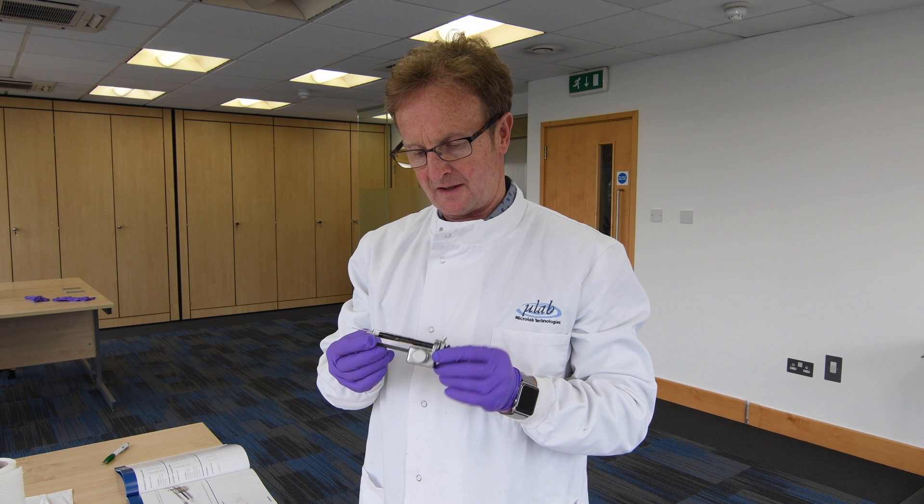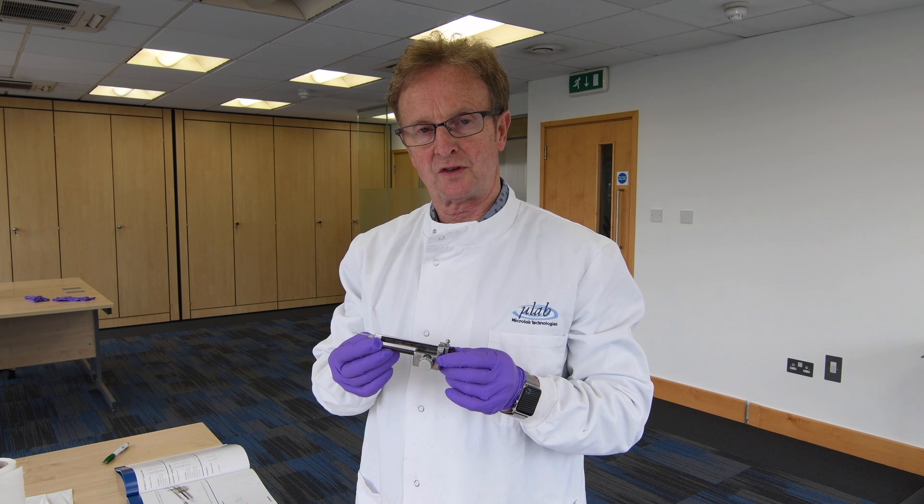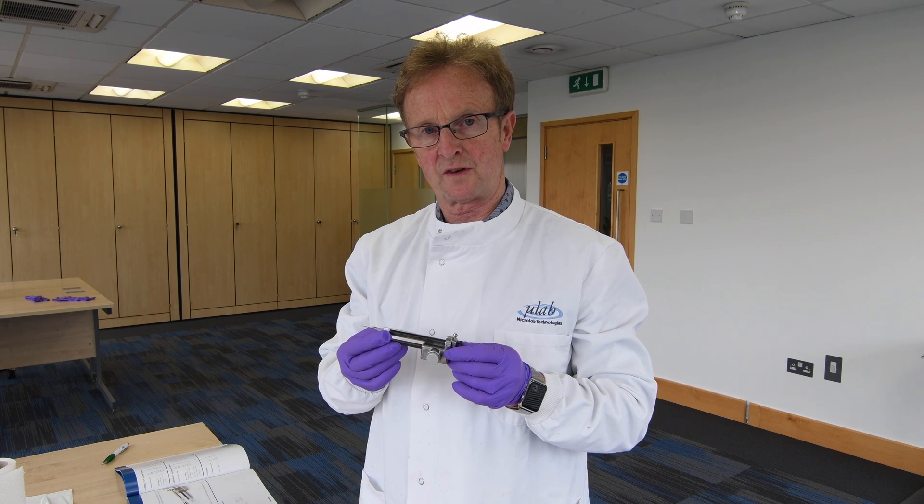So here we're going to look at the whole device, take this apart, and then I'll show you how we assemble this small piece of equipment.